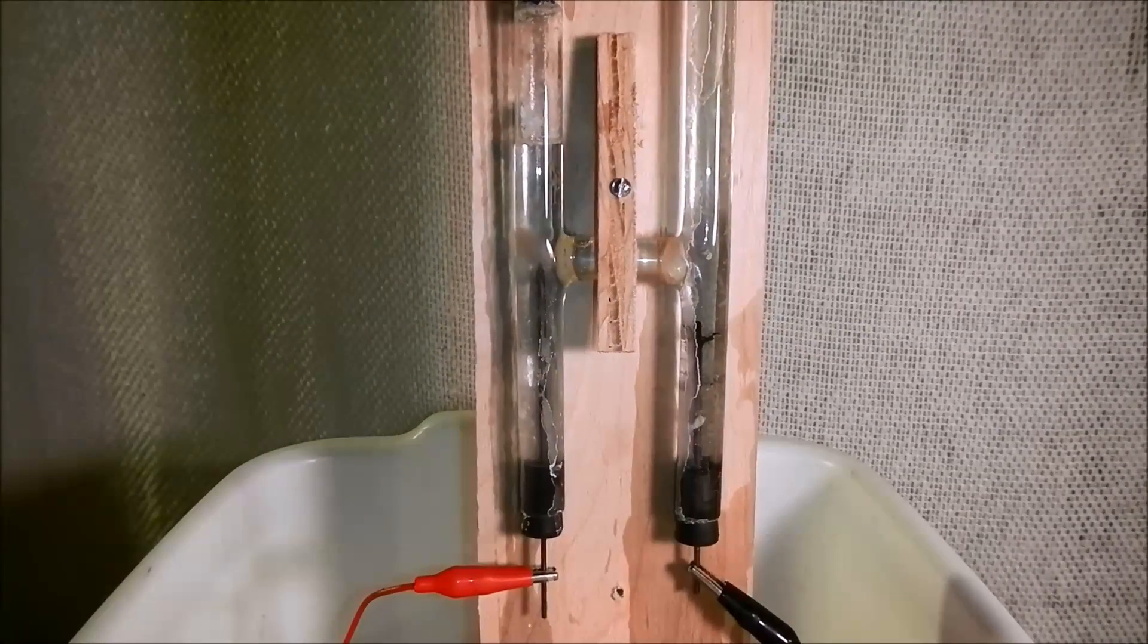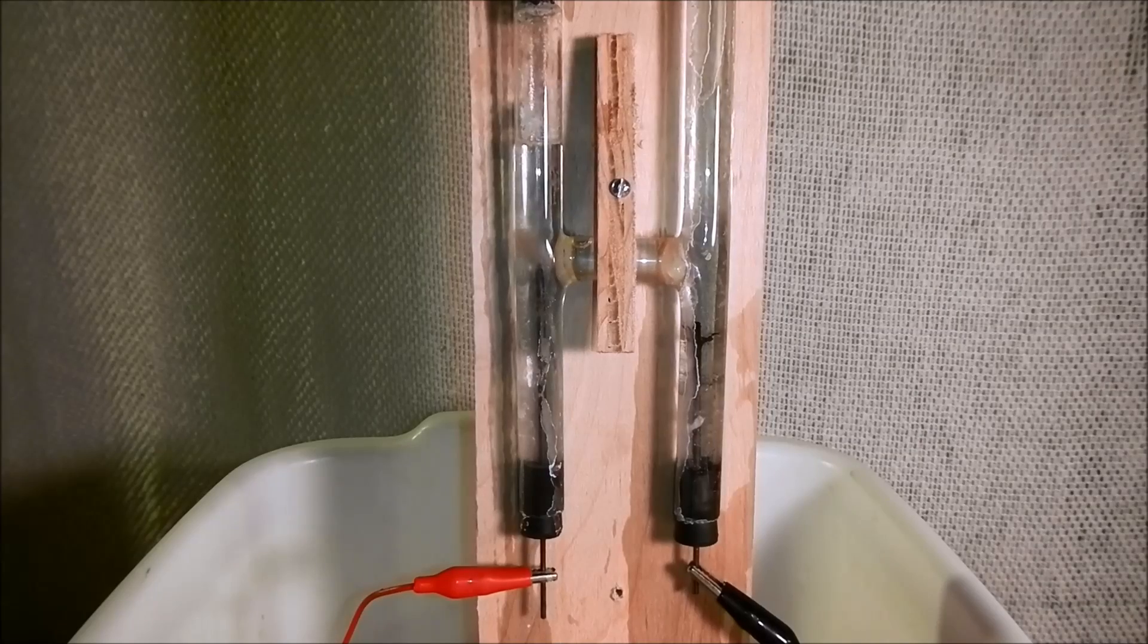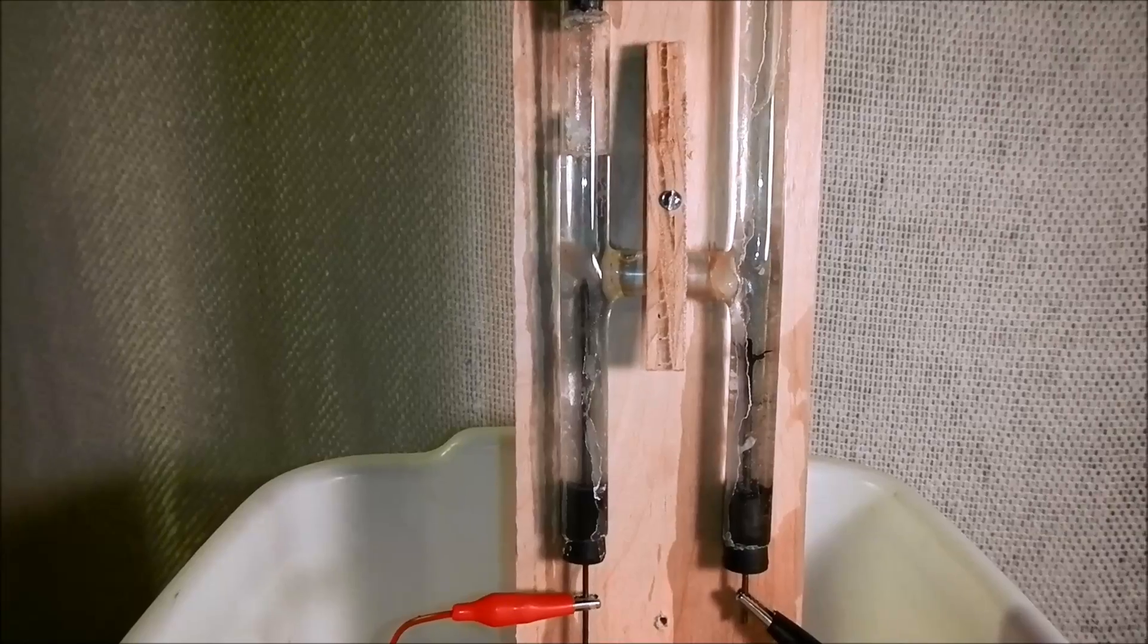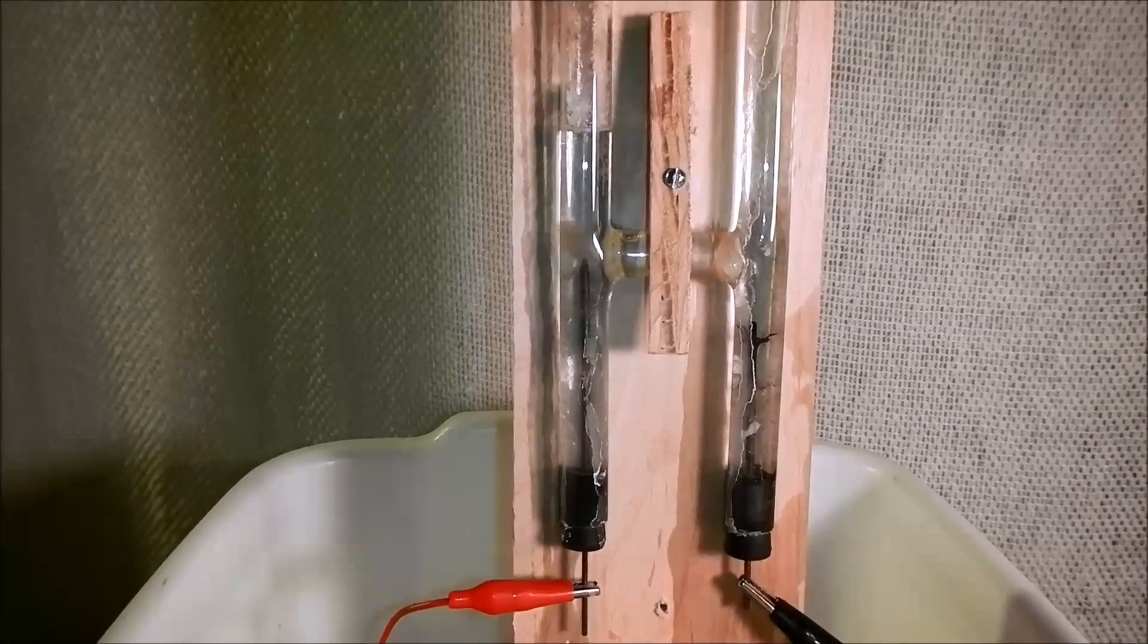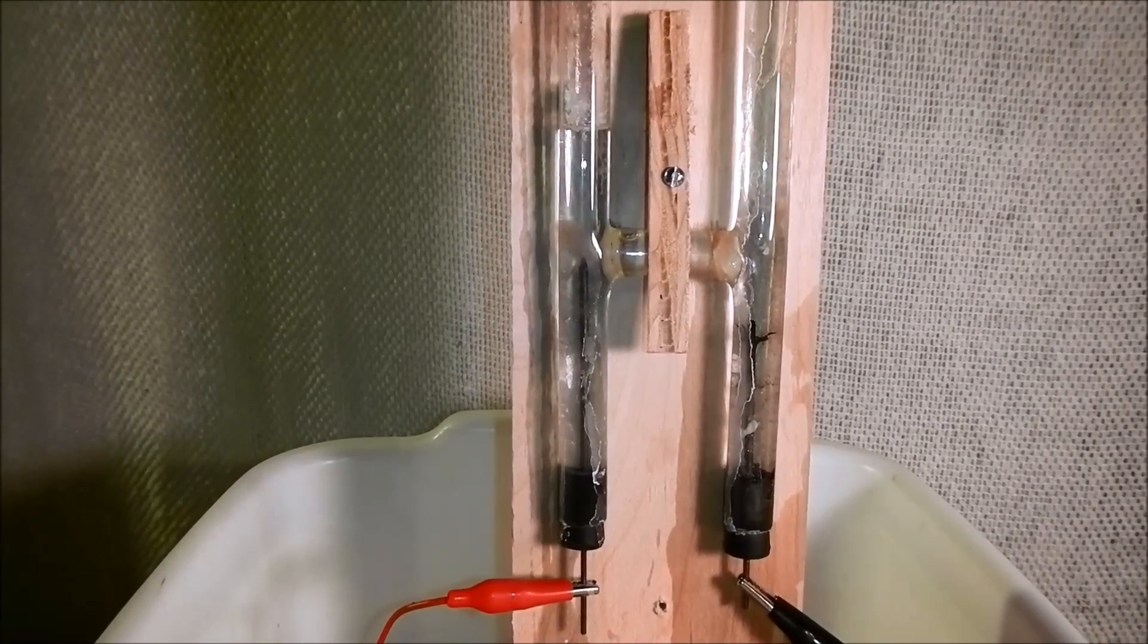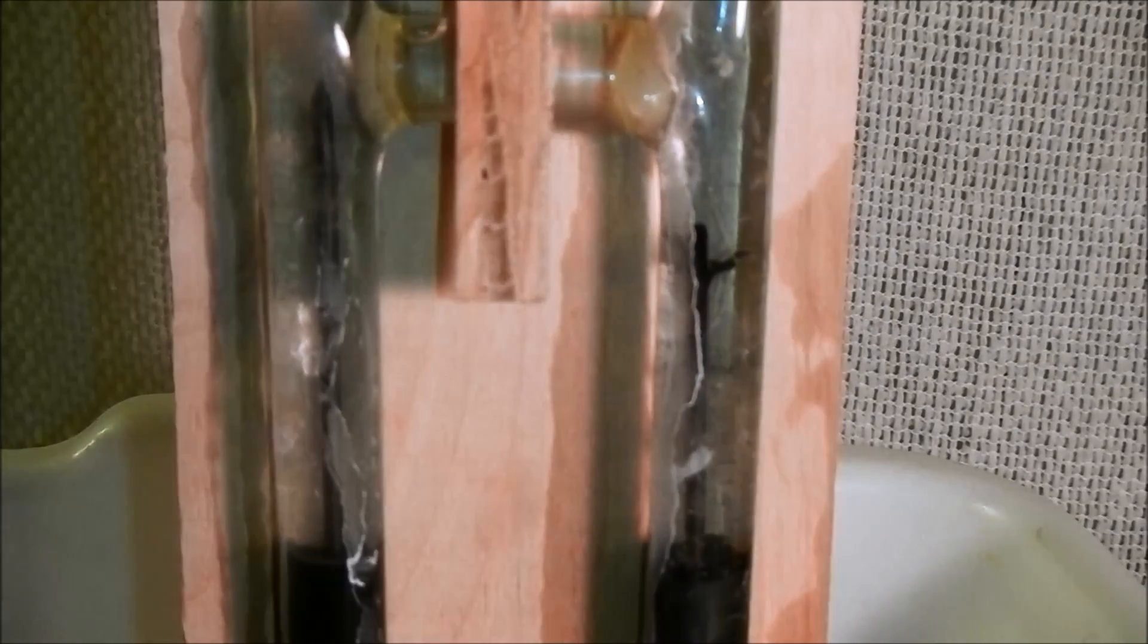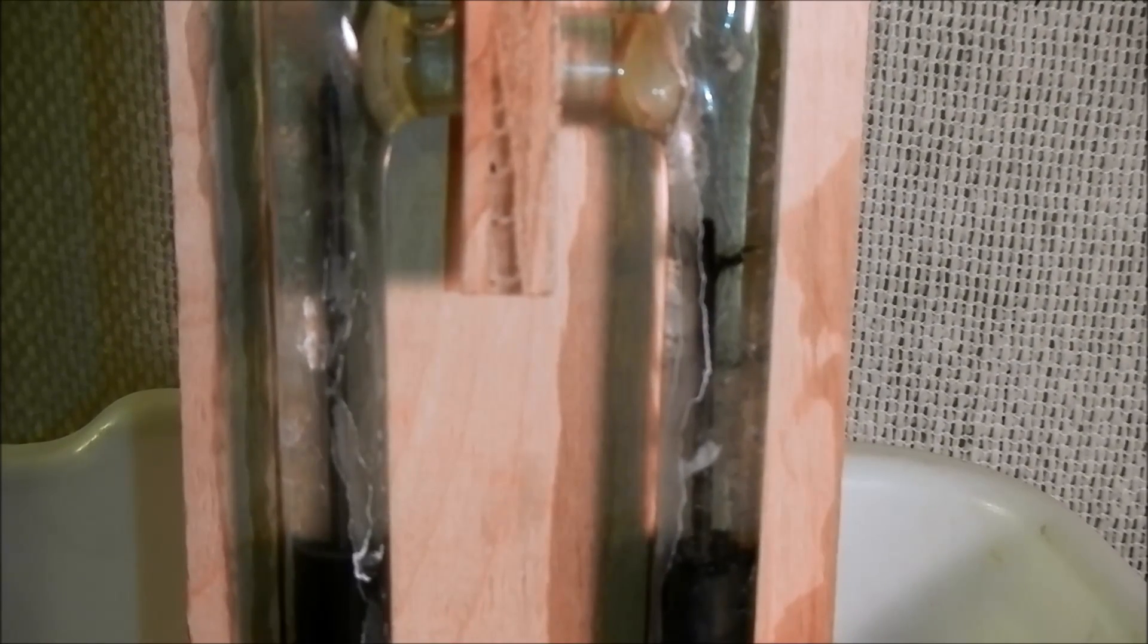The byproducts of the electrolysis won't really corrode the electrodes very much. So that's one of my favorite things to use as an electrolyte. And if you look here, the carbon pencil leads don't really corrode very much.